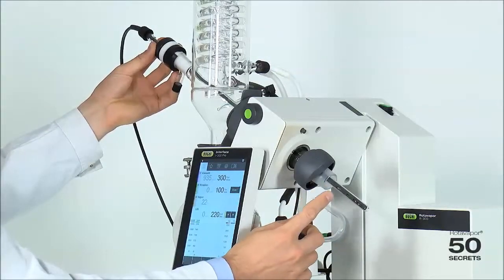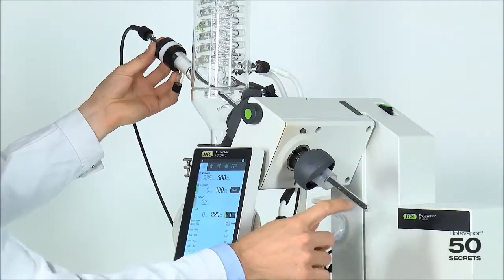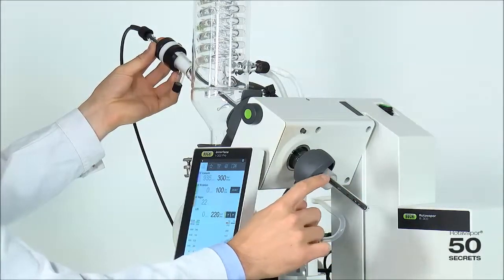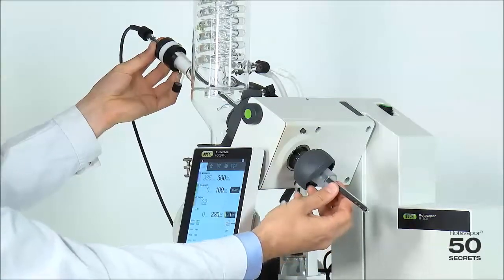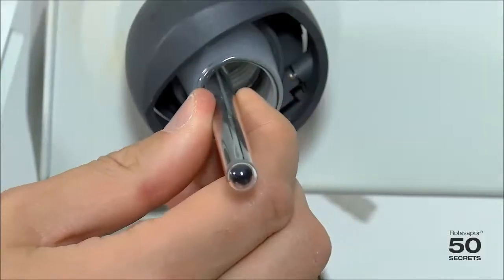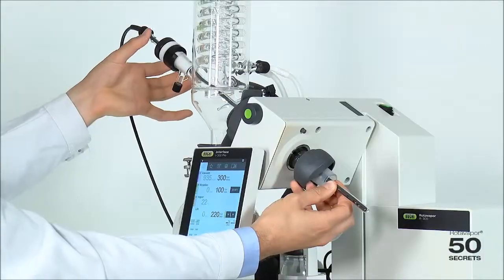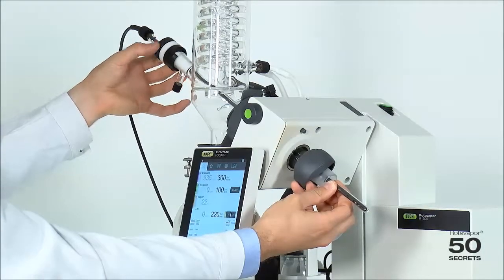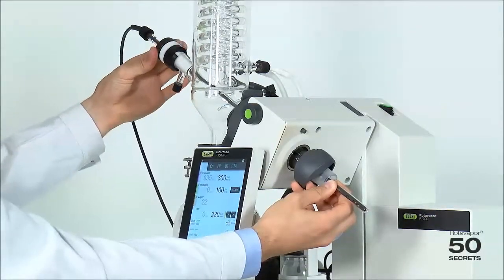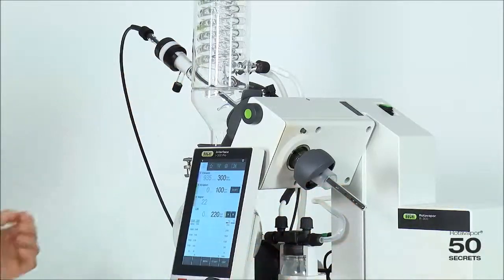When mounting the foam sensor, it's very important that the tube of the foam sensor, the glass tube, doesn't contact the vapor duct. Therefore I just hold it here in the middle and I make sure that I screw this top. I screw it quite tightly and I release everything.